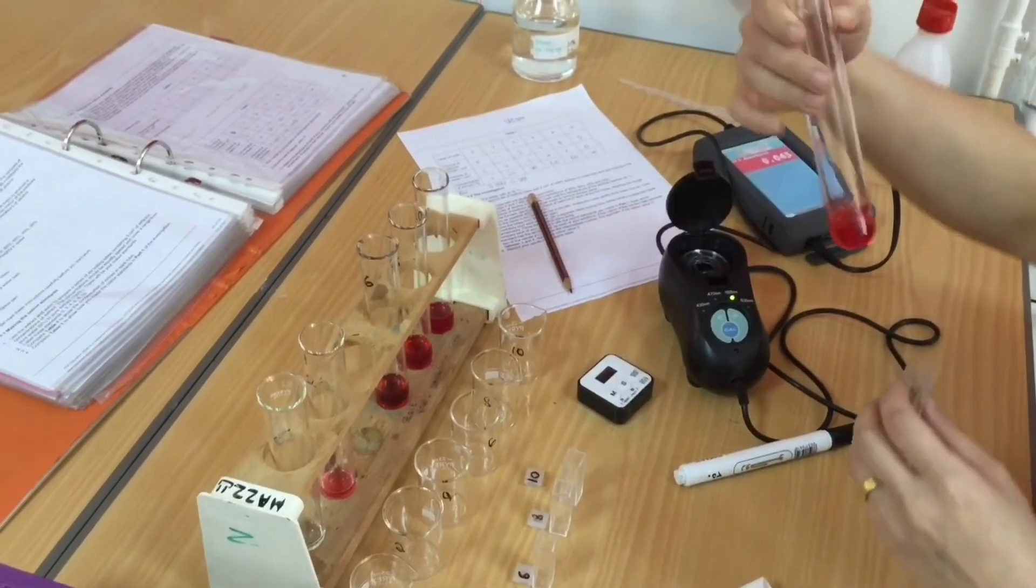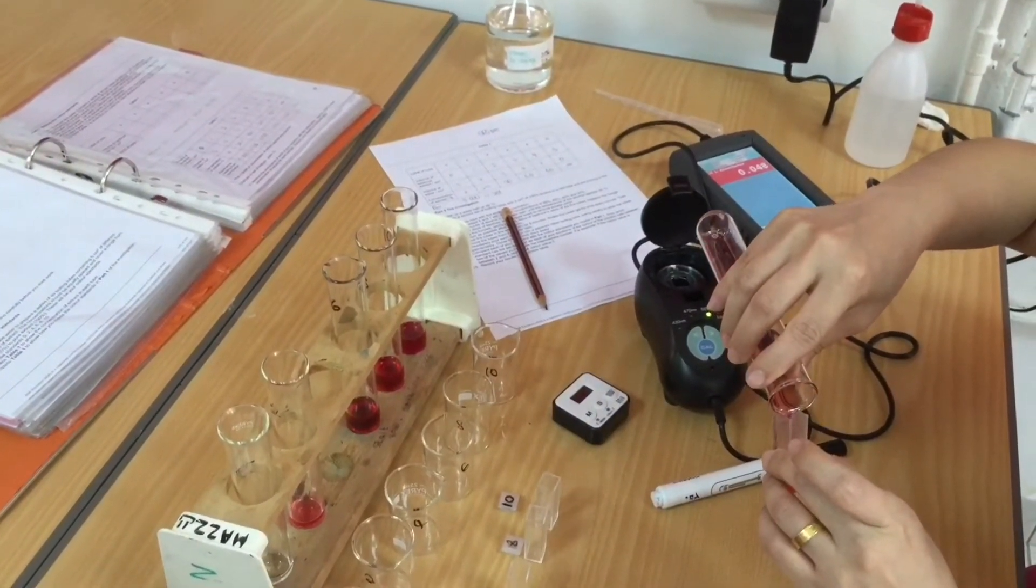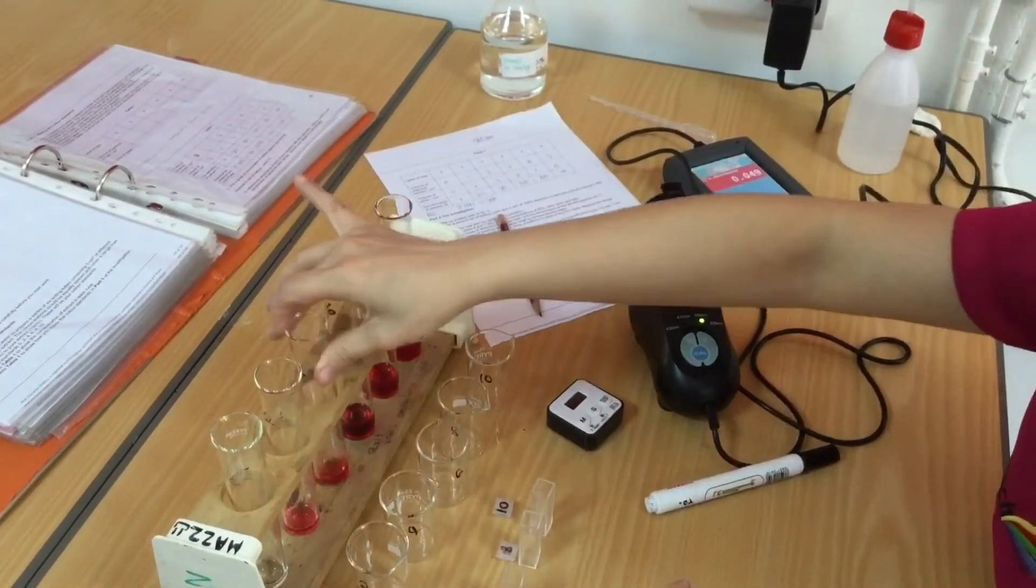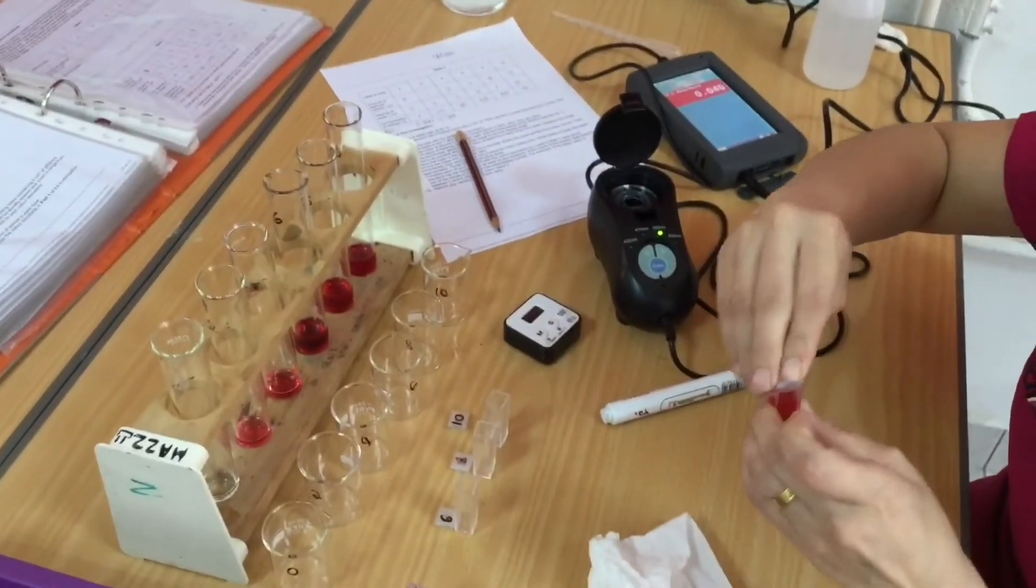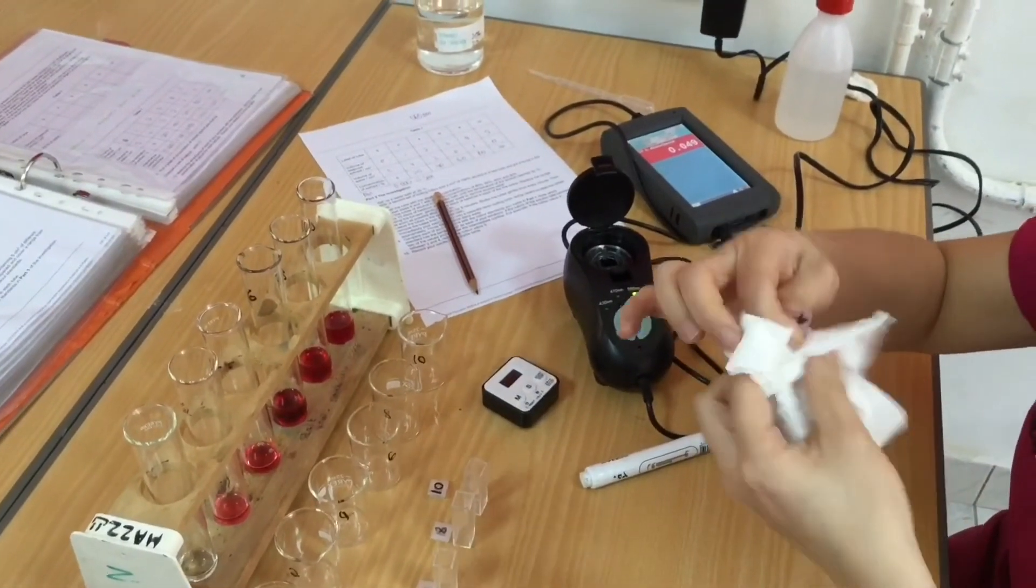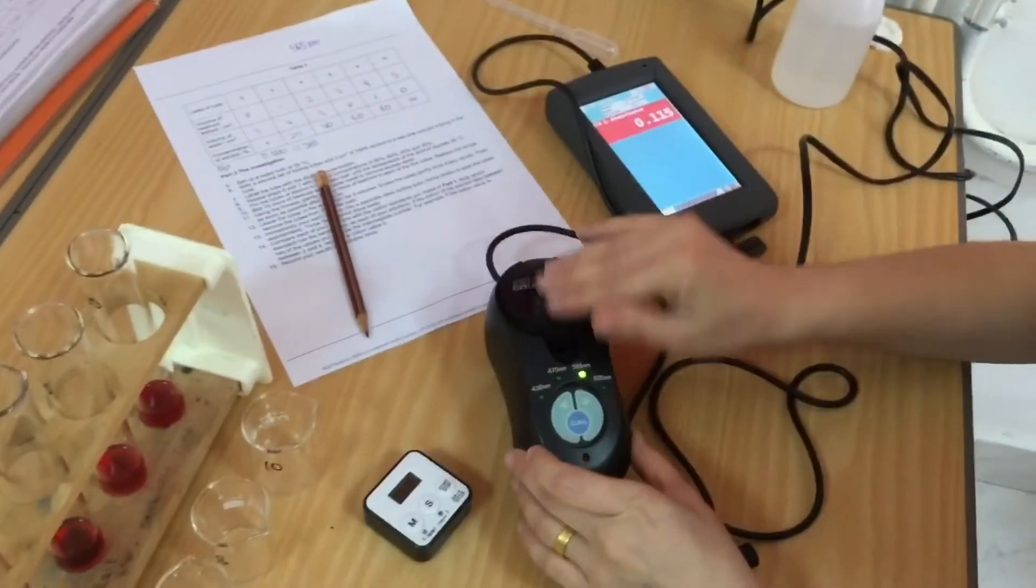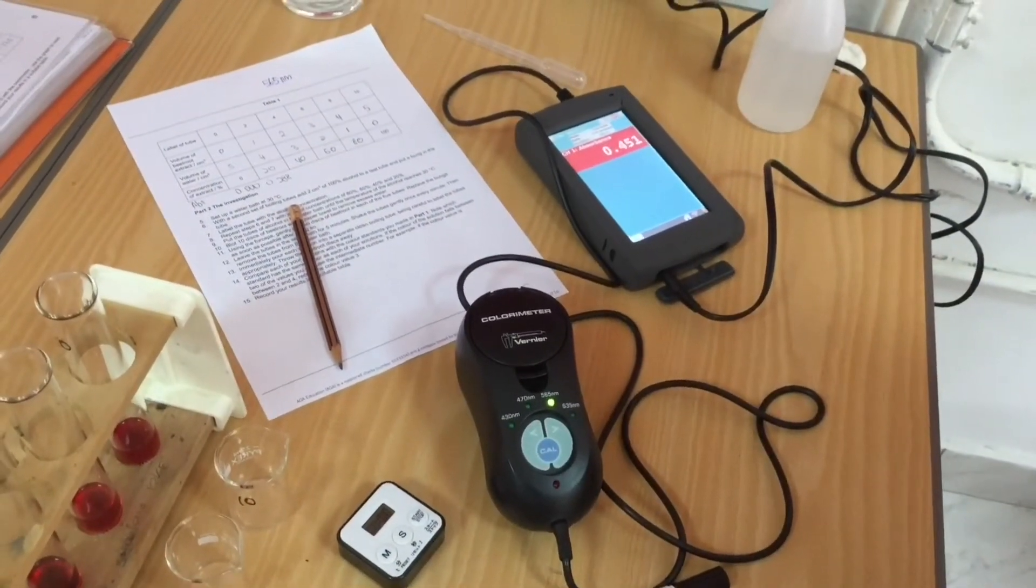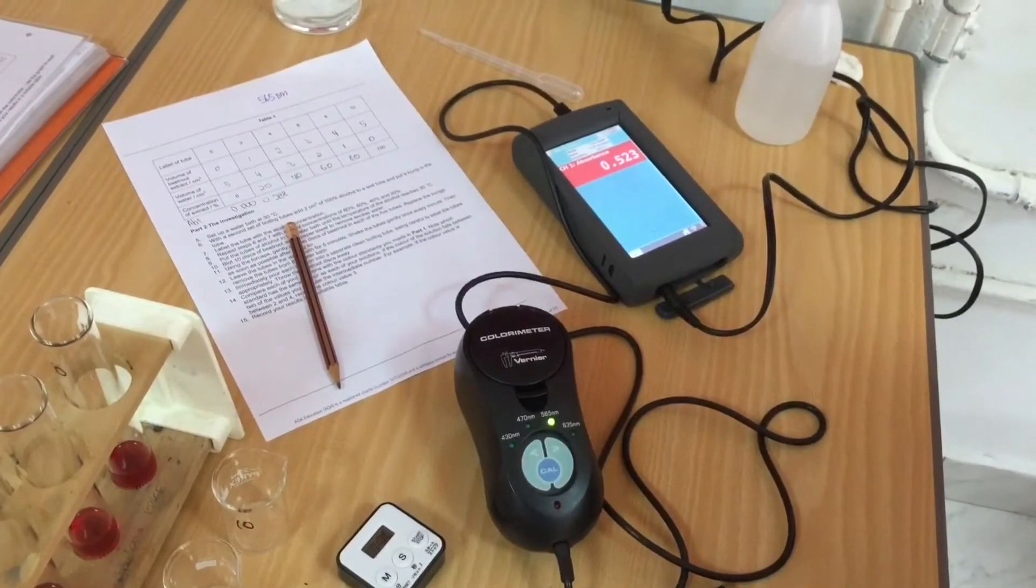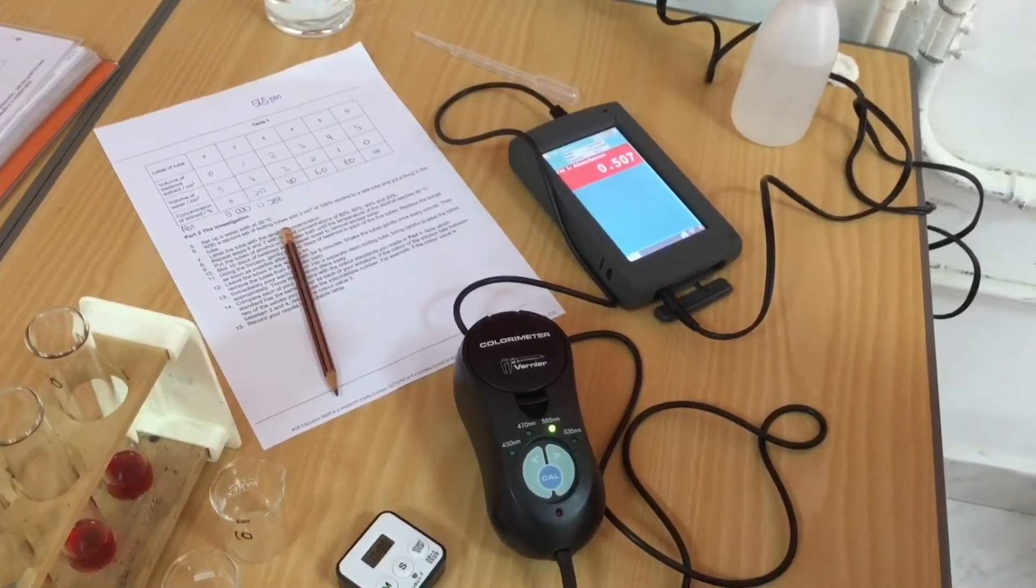Give it a shake, because you might have some starchy bits, it may be a little bit cloudy your stock solution, and we want a representative sample. We're working quickly because as that is sitting, the ethanol is evaporating, and of course that's making your stock solution and certainly the concentrations that you've made change in terms of their concentration.